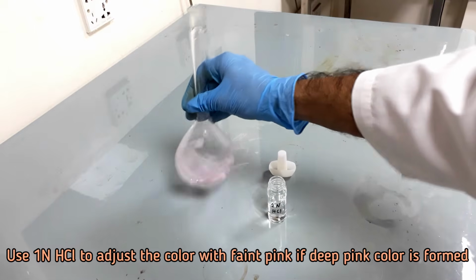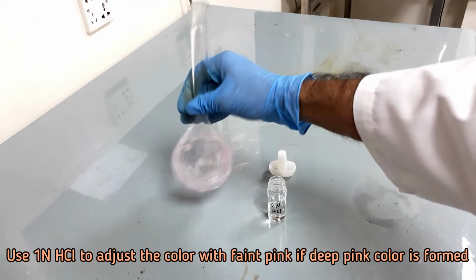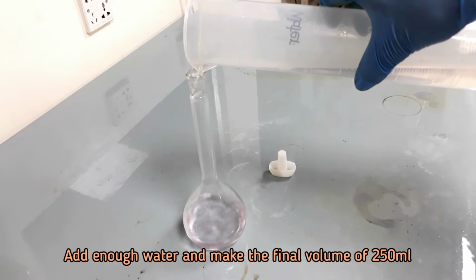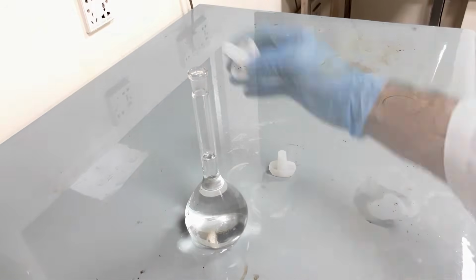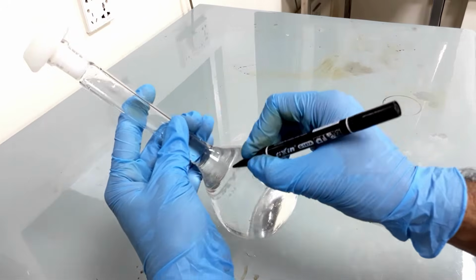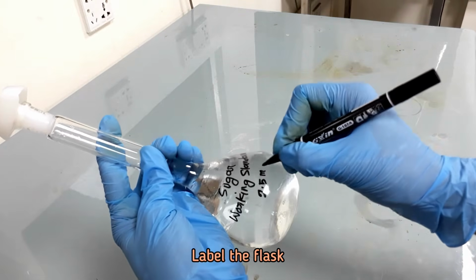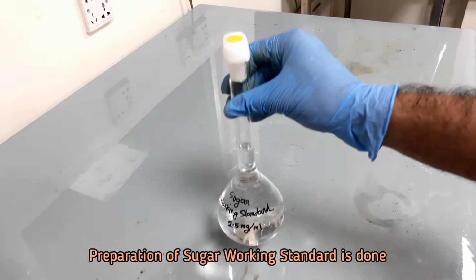Use 1 normal hydrochloric acid to adjust the color to faint pink if deep pink color is formed accidentally. Add enough distilled water and make the final volume of 250 ml. Swirl the flask to mix the content and label it. The concentration of this working standard is 2.5 mg per ml. Preparation of sugar working standard is done.